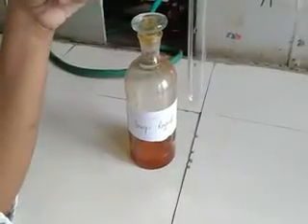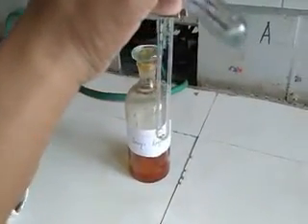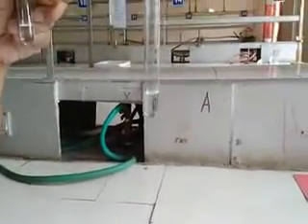Now we will do the test for carbonyl group detection. I will take 2 ml of organic sample solution and add 2,4-dinitrophenylhydrazine, that is Brady's reagent. As you can see, no yellow precipitate has been formed, which infers that the given organic sample does not contain a carbonyl group. As the test for carbonyl group is negative, we will not go for the tests for aldehyde group and ketone group.